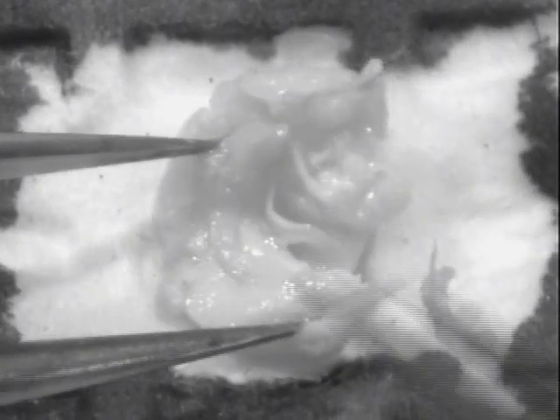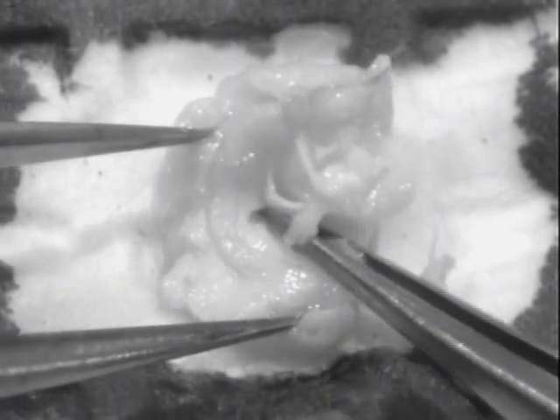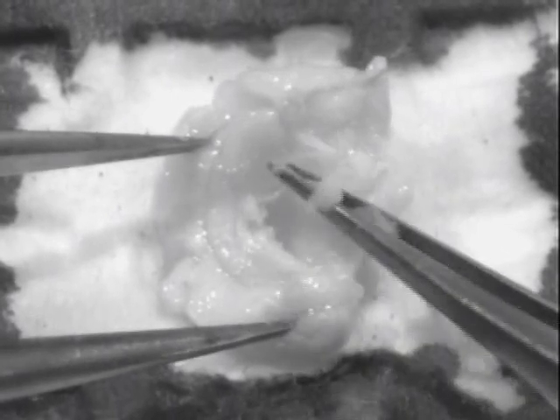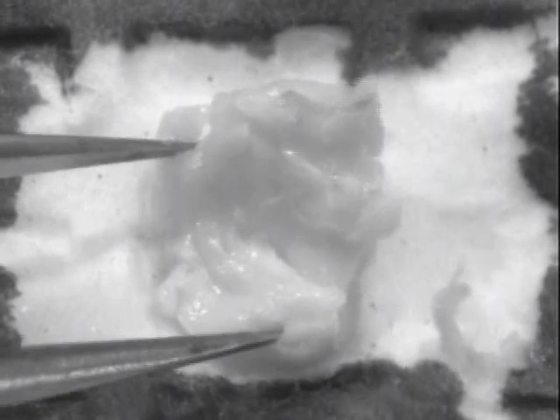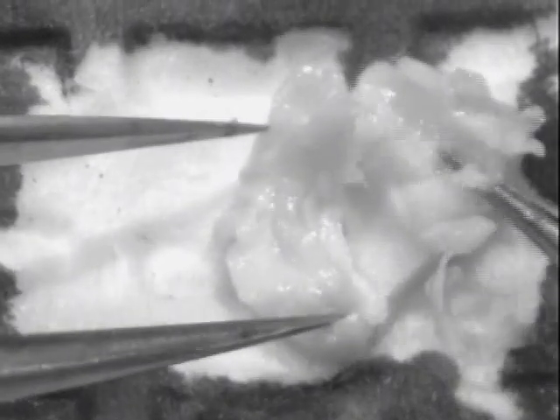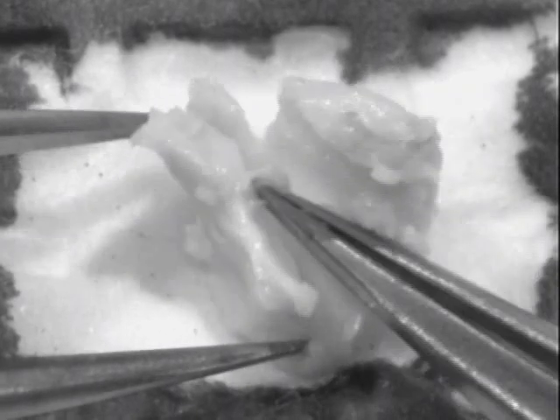If you're culturing the hippocampus, cutting that white matter tract off will help keep the oligodendrocytes out of your culture. There I bumped the CA3 region a little bit, damaging it, but for the most part I've just cleanly cut the white matter out of the hippocampus. Now I'm going to roll the hippocampus out away from the cortex.